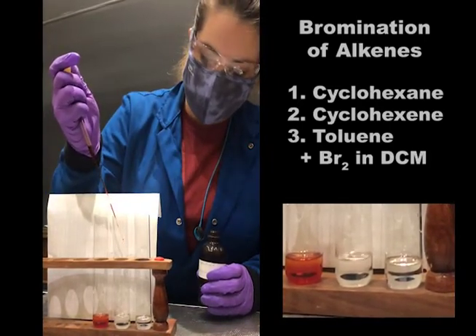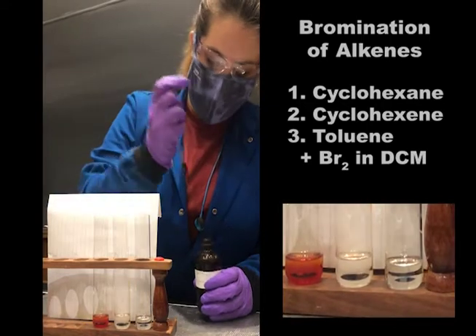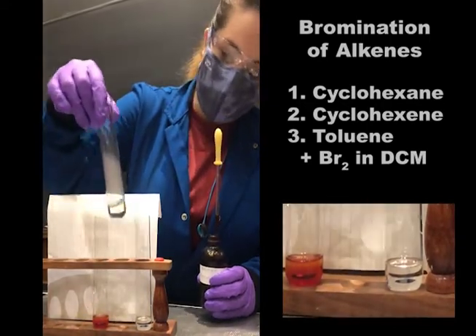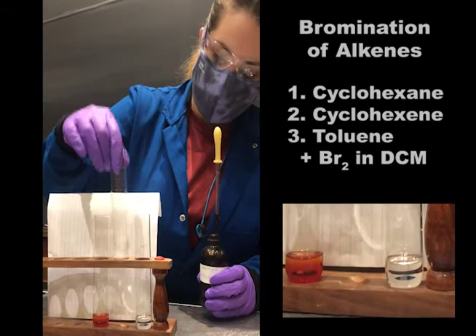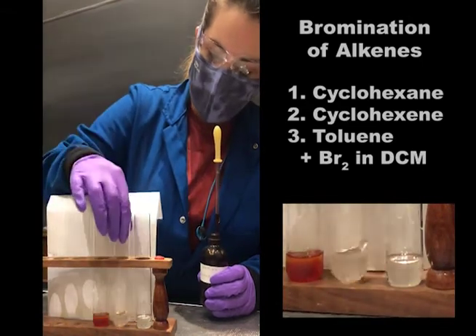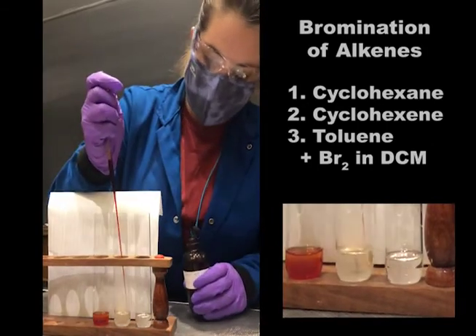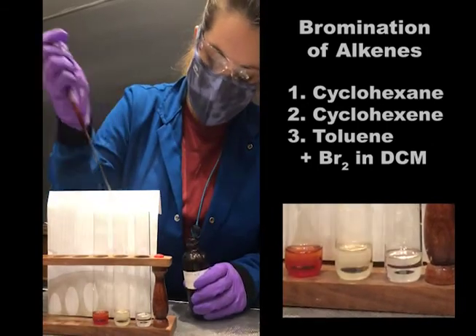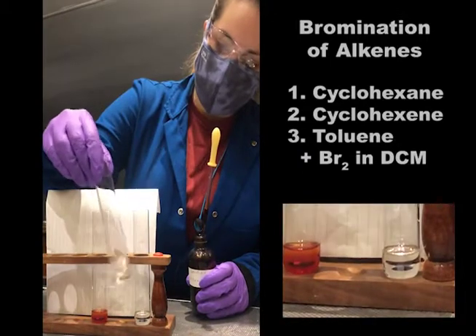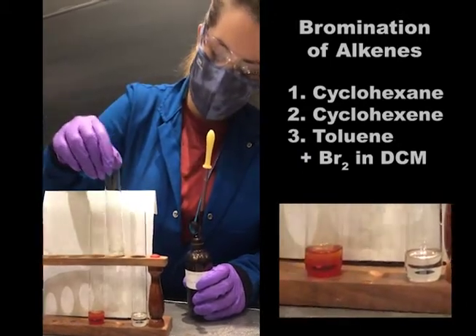Now we'll add it to the cyclohexene, and if you can see, upon addition the orange color goes away. We can show you that one more time — we're adding this bright red solution and the color goes away.